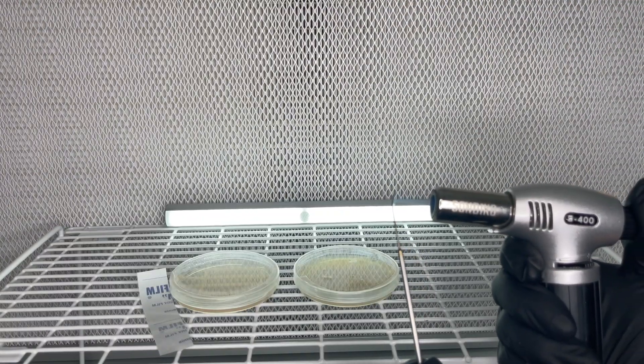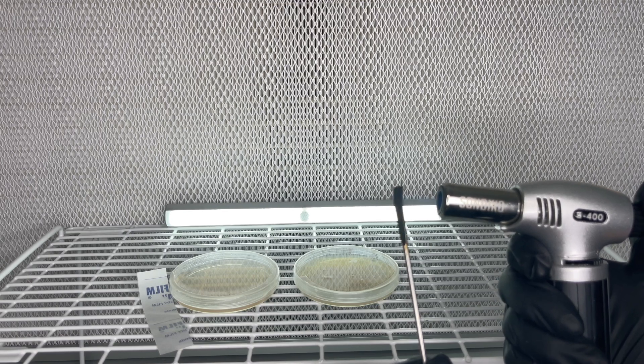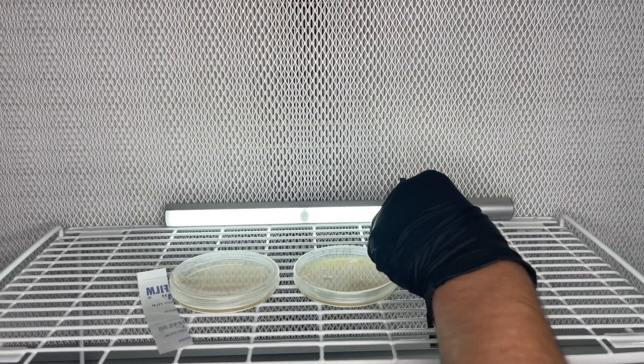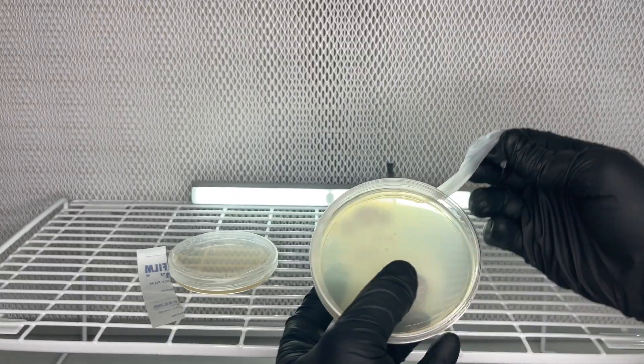And now I flame sterilize the scalpel and then transfer a piece of that agar plate to a new one just to make sure that I have completely isolated the mycelium away from any contamination.